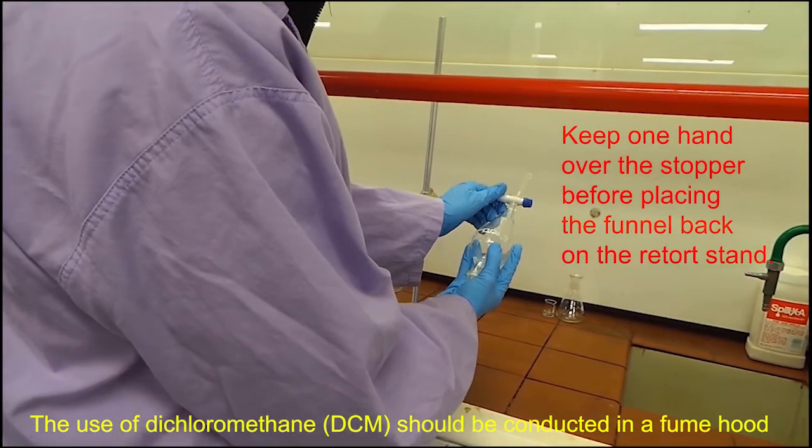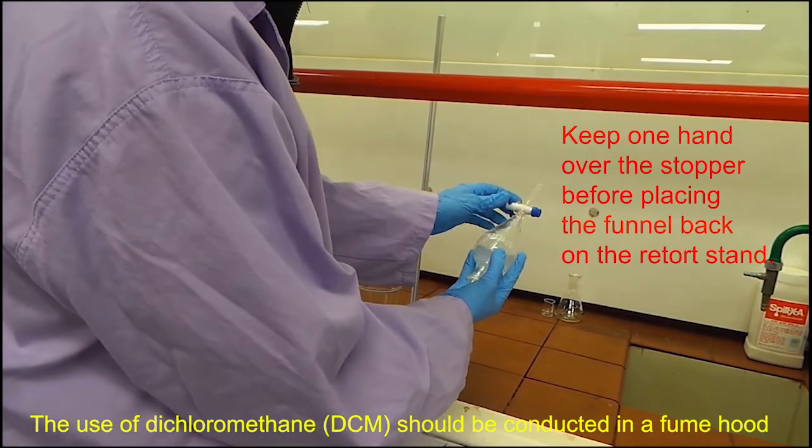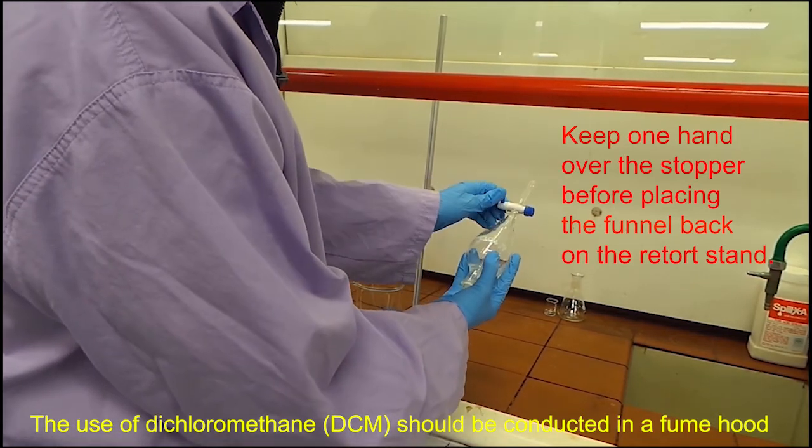Using a rocking motion, move the separation funnel and at regular intervals release the valve to release pressure. Continue to do this until you cannot hear the sound of pressure releasing.